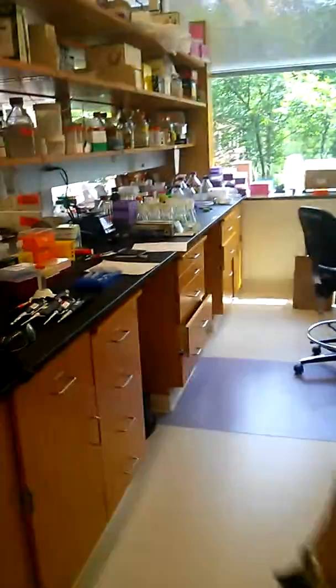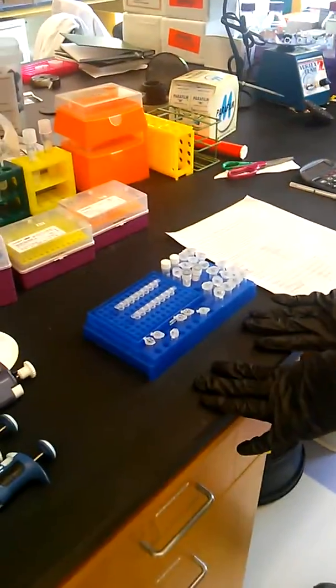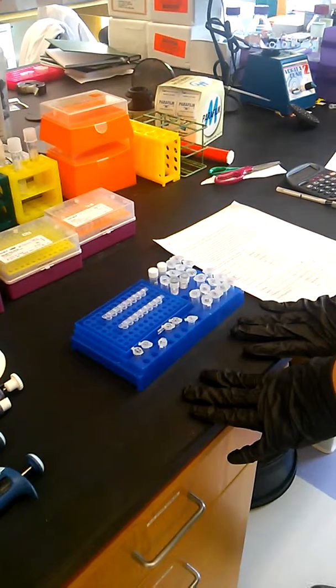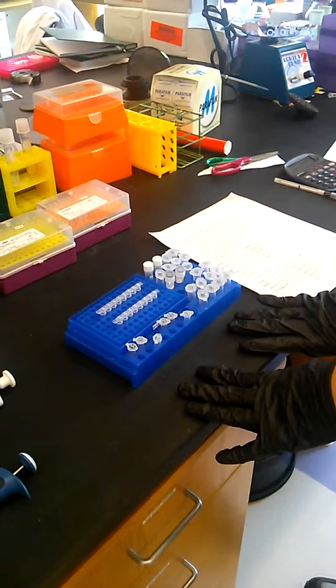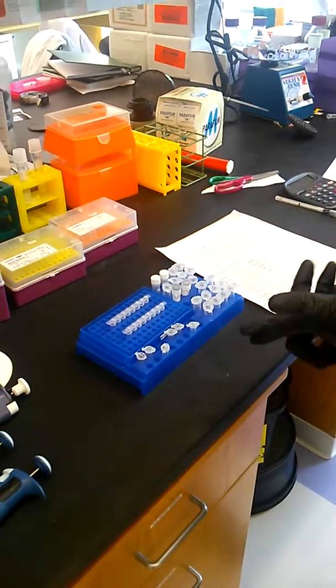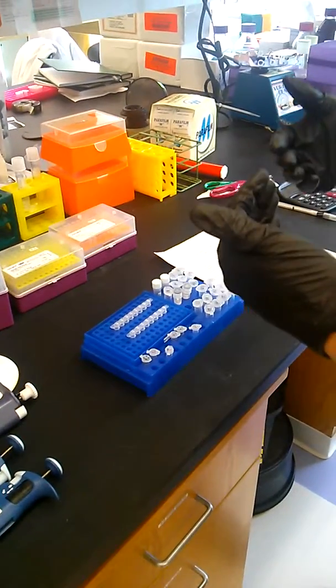So now we're going to walk over to my bench. And I've done that. So I have all of the main components that you need to run a PCR reaction. So those will be some sort of template. So that's the DNA that you're going to use that you want to amplify the sequence of.